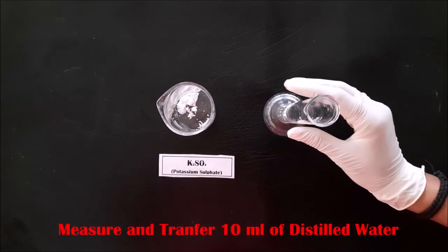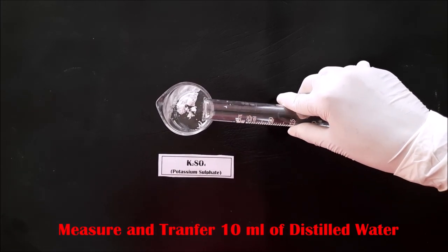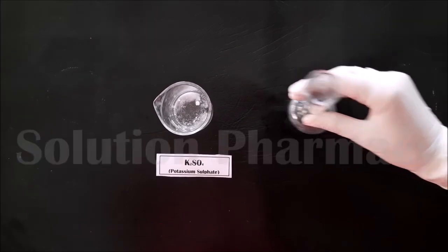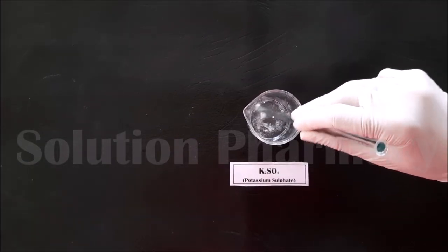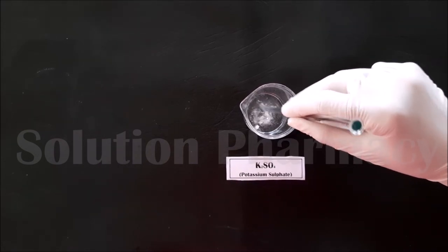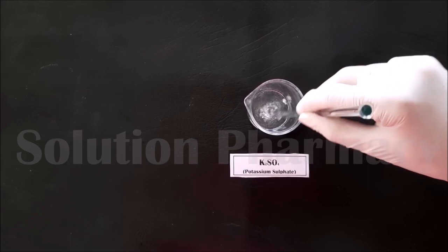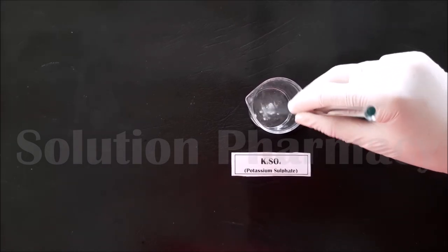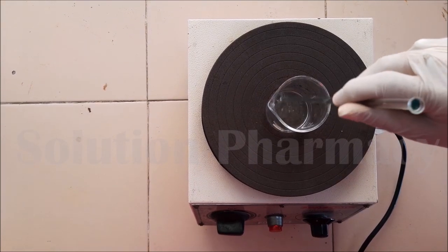Transfer the 10 ml of distilled water into the beaker containing 1.1 grams of potassium sulfate. Then, with the help of a glass rod, stir it properly to completely dissolve the potassium sulfate in distilled water. Also, gently warm the contents of the beaker to help dissolve it completely.